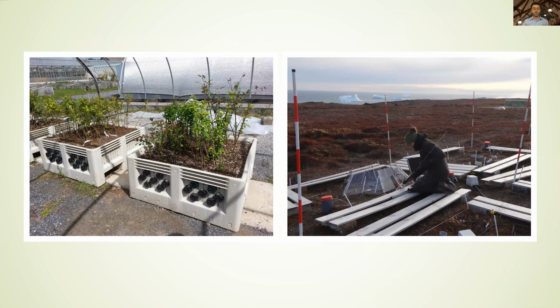Just to give a good example, here we see tubes in a horizontal method. They have installed them right throughout the bed of these different boxes. You can take the scanner, place it in one tube, do your scans, pull it out, place the cap back in, and just keep doing that repeatedly, fairly rapidly, being able to get a full record of all of the root systems for all the plants right there.